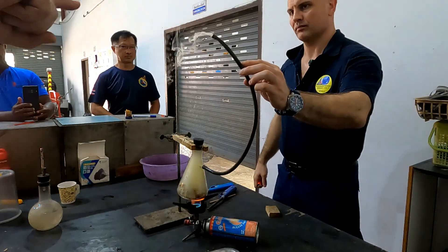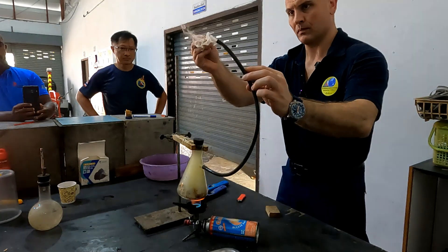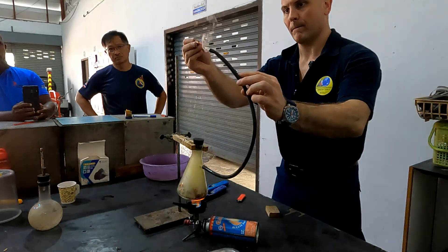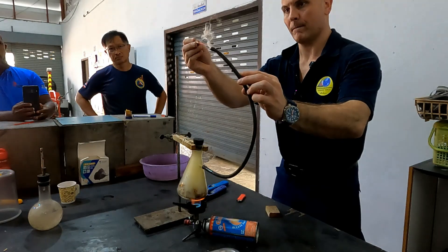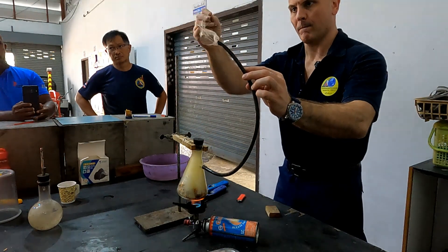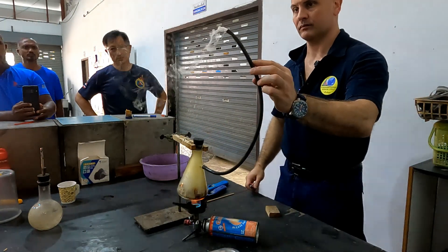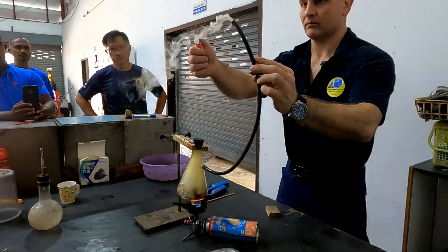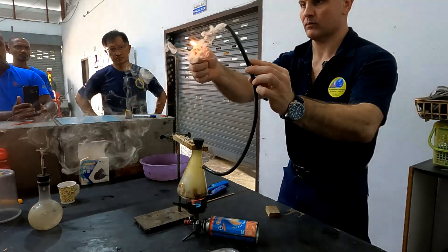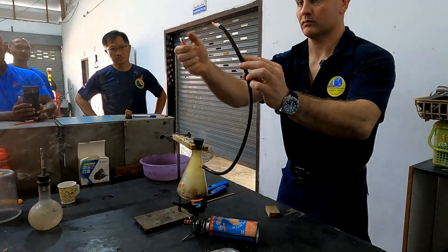So now it's starting to change. Initially it was coming out and vanishing — only water. Now some of it is going away as smoke. So at 100 degrees Celsius we start to get the water vapor in the timber released.